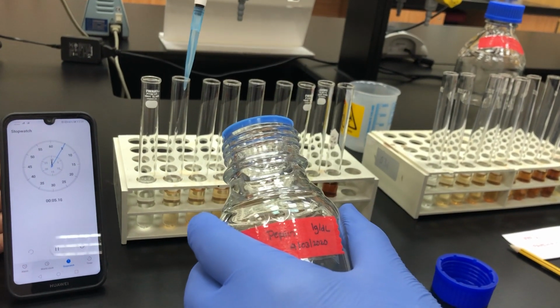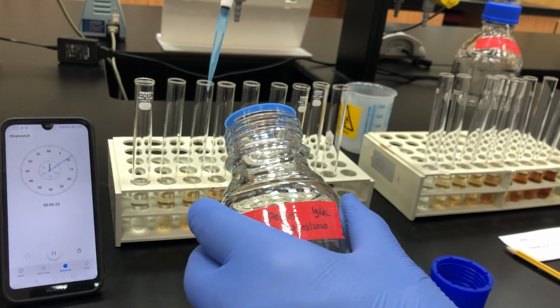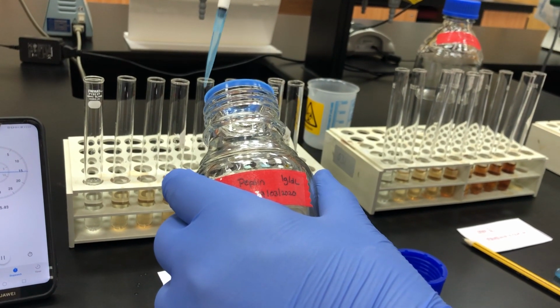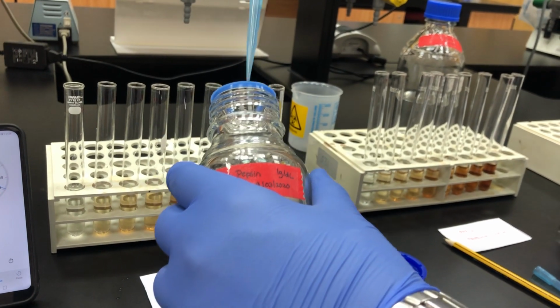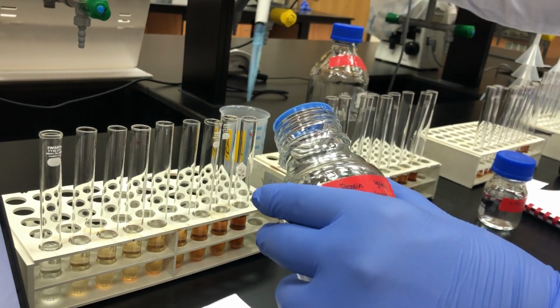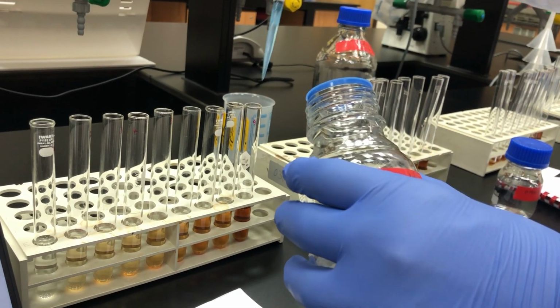Again, 2, 3. It's okay, guys. 4. For all of them, 5, 6, 7, 8, 9. Here, when you add the pepsin, I already start the timing.